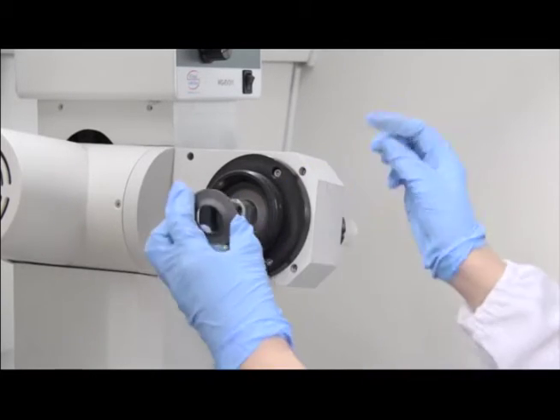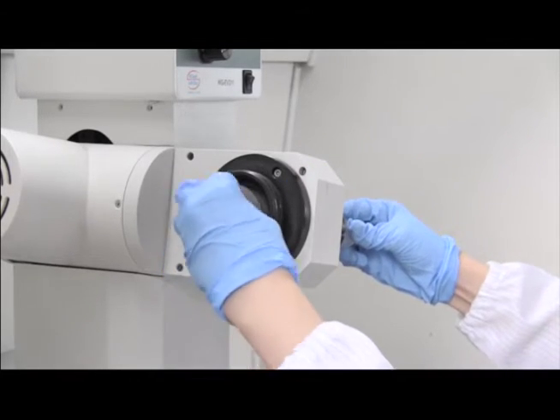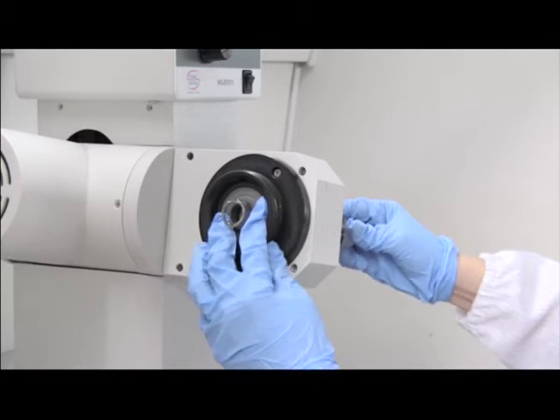The next step is to install the grey sealing ring. Please make sure that the side with the flat surface is down, then push through the vapor duct.